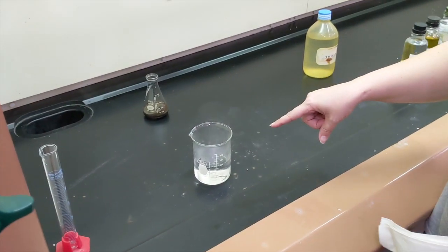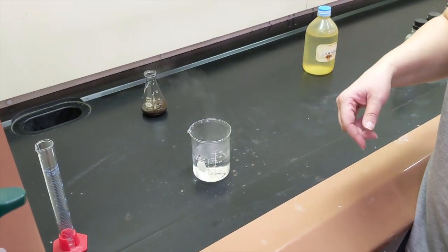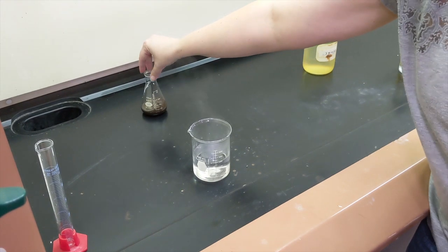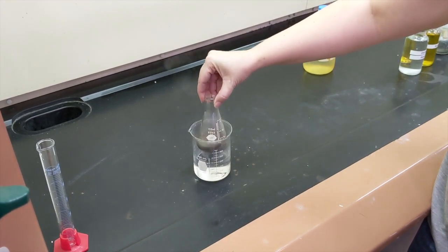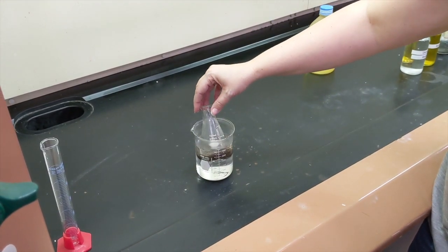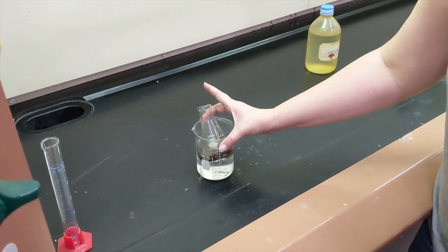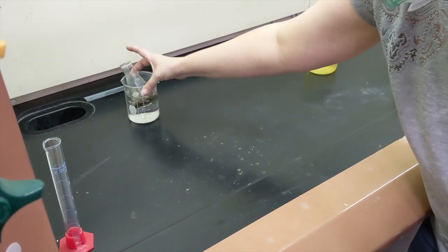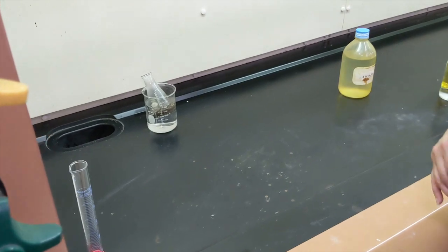All right, we have our boiling water. I didn't show you me carrying it over, but I think you could figure out what happened there. I'm going to put my Erlenmeyer flask inside my water bath, and I'm going to scoot it back to the back and let that react for a little while.